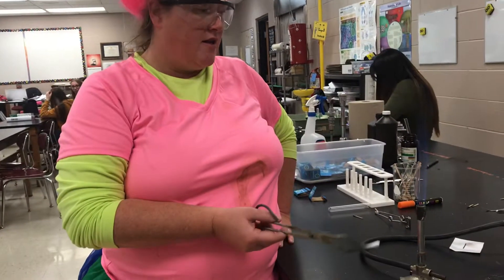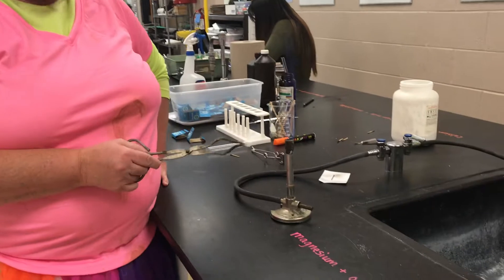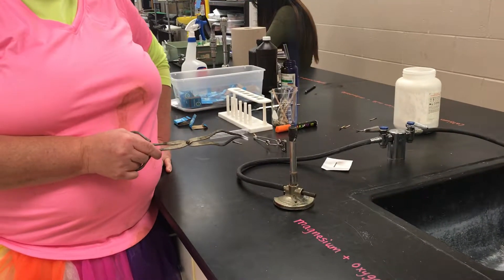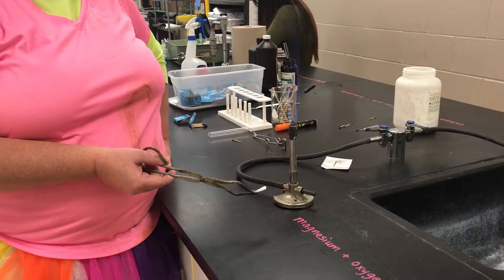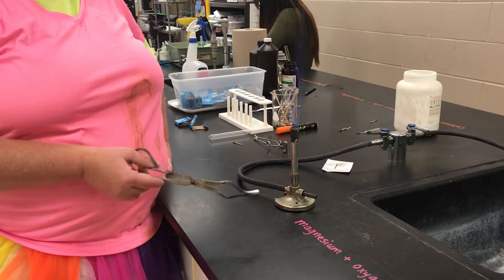This reaction is very exothermic because it gives off heat and light — it gives off energy. It did require a little bit of a boost, a little bit of activation energy to get it started, but once that happened the reaction proceeded to give off lots of heat energy, which makes it exothermic.